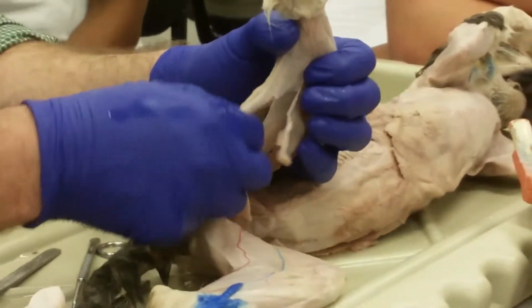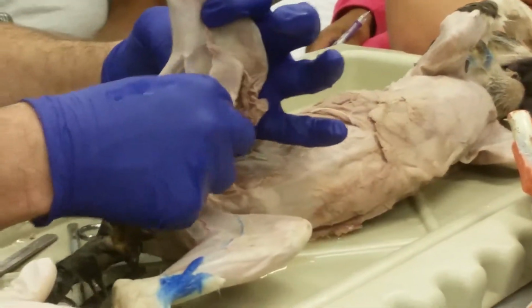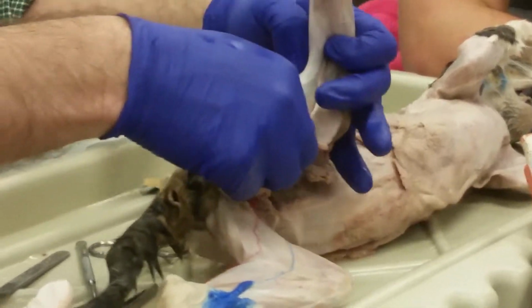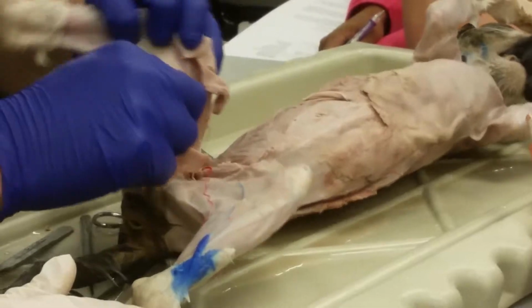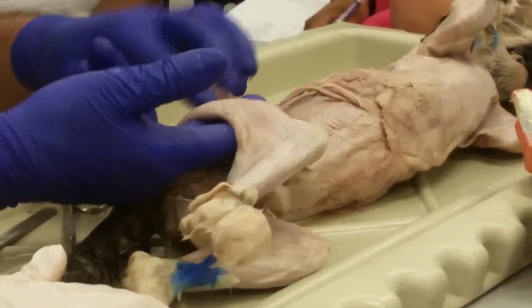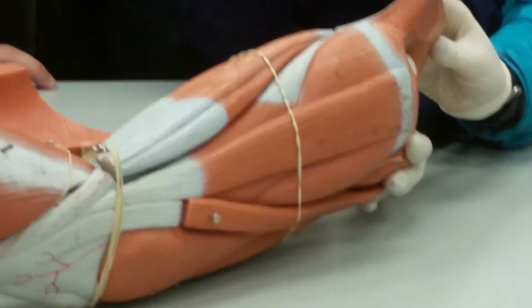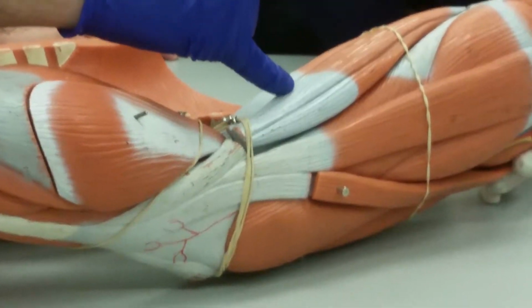That's silly. All right. There's your semitendinosus. And then just in front of it, just behind it's your semimembranosus. Okay. These are two of your hamstrings. Semimembranosus, semitendinosus, and then on the lateral side, this big muscle which covers the entire lateral side of the cat's thigh, the biceps femoris. Okay? These are our hamstrings. The lateral one is the biceps femoris, and then we have two medial ones.